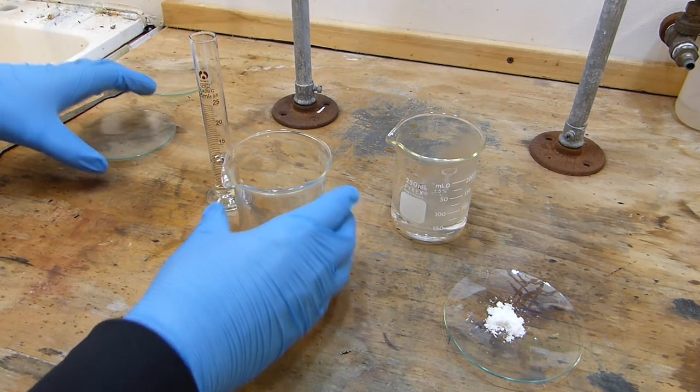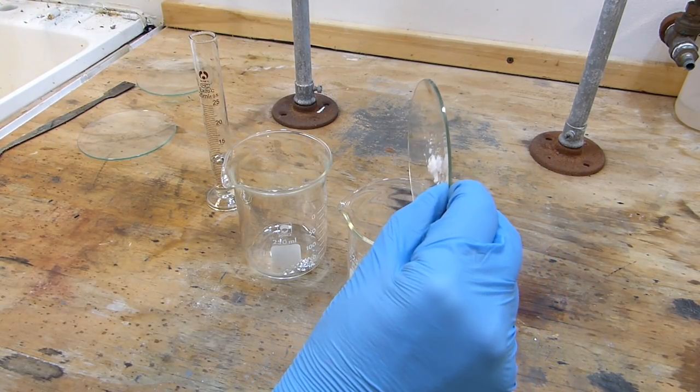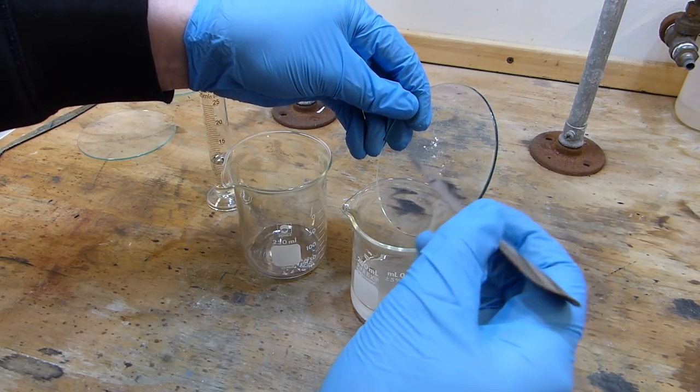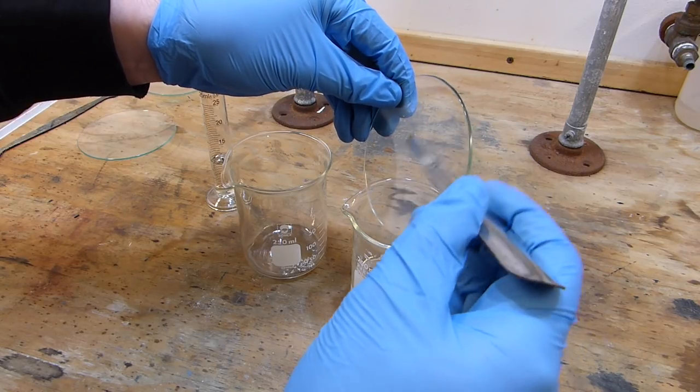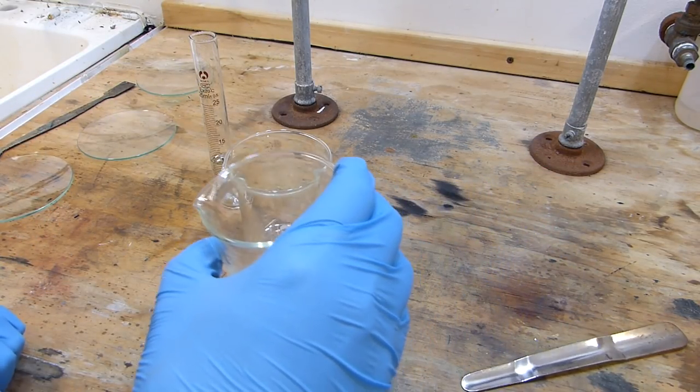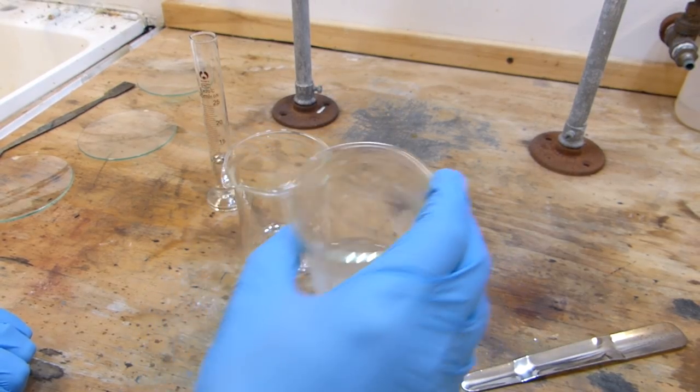Regardless, we can now add our potassium iodide solution to the hot water. Nothing spectacular is going to happen here. It's very soluble in water so this is going to go into solution extremely quickly and in fact it's already pretty much gone.